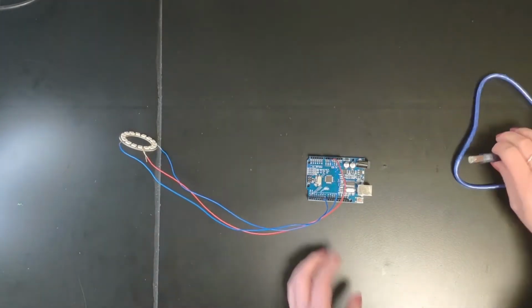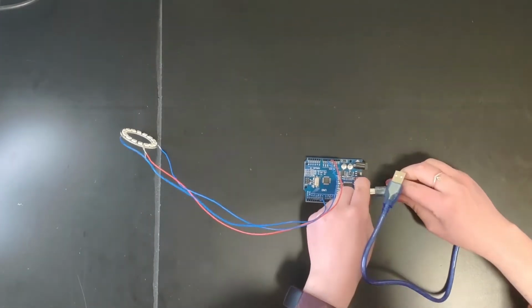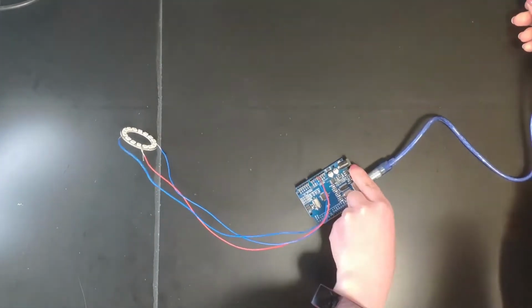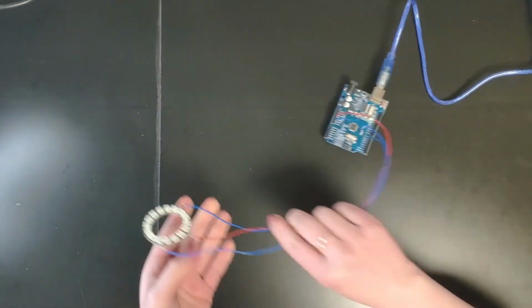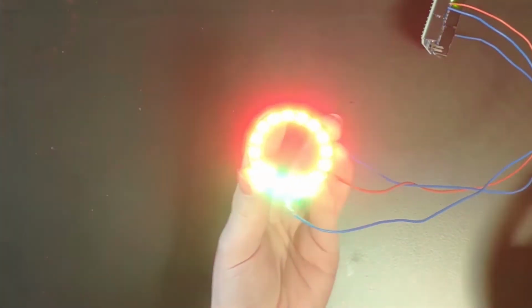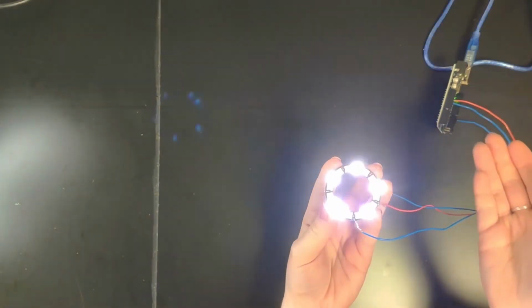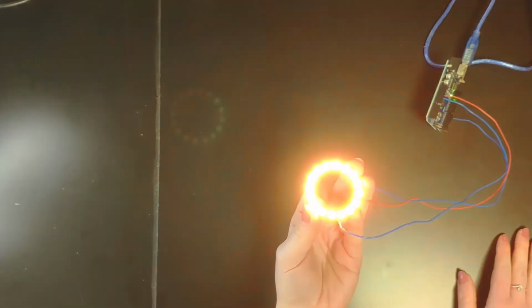So next we're going to plug in our Arduino into the laptop to give it power, and we're going to run one of the demo files for the pixel ring, and it's called strand test. So now you can see the pixel ring is lighting up all different colors.